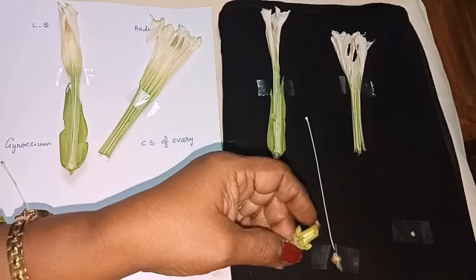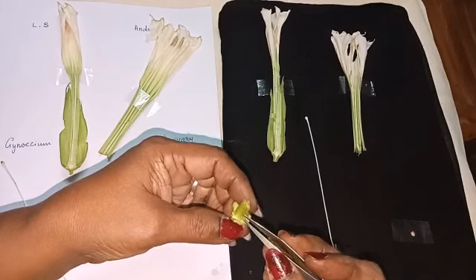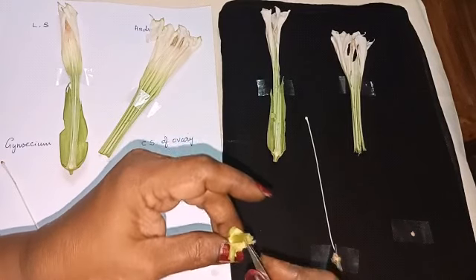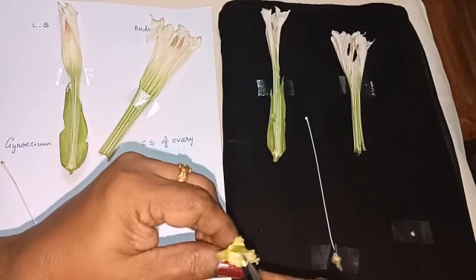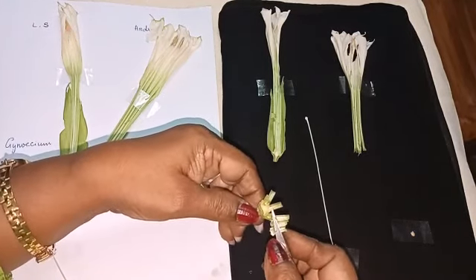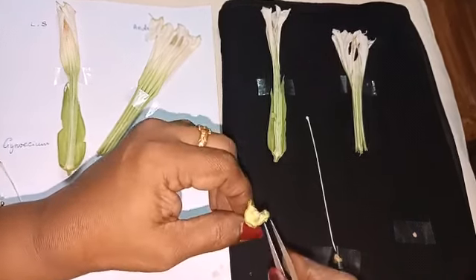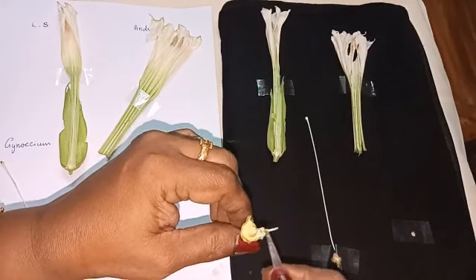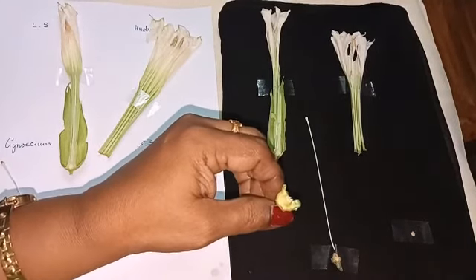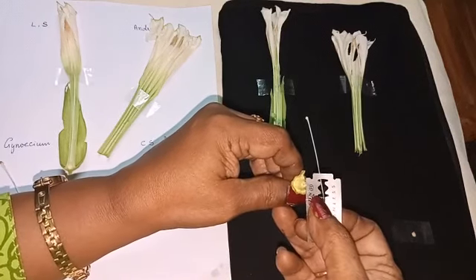For isolating this Androecium, we have removed this part, this portion. From that, you can remove all these extra parts. See, can you see the ovary? A part of the stigma is there. Remove the stigma. This is the ovary. Can you see the ovary? This one is the ovary, and you have to take a section, thin section, cross section, CS.